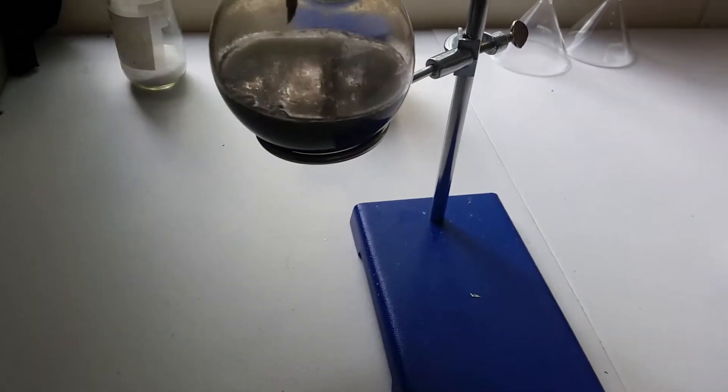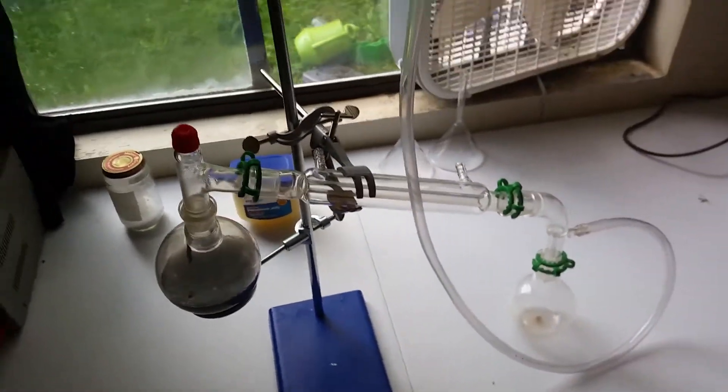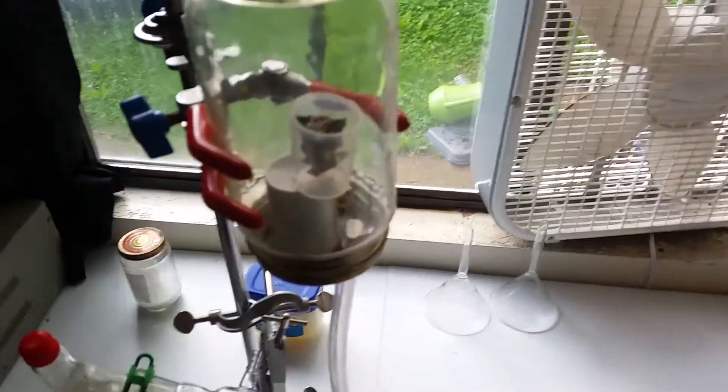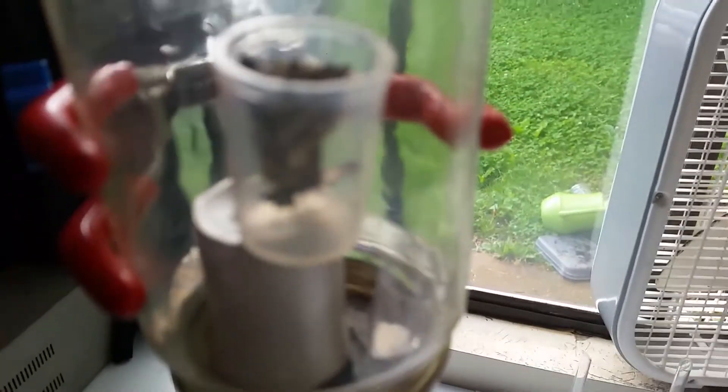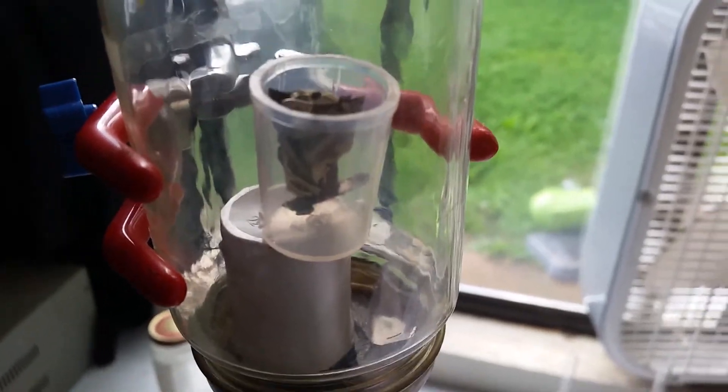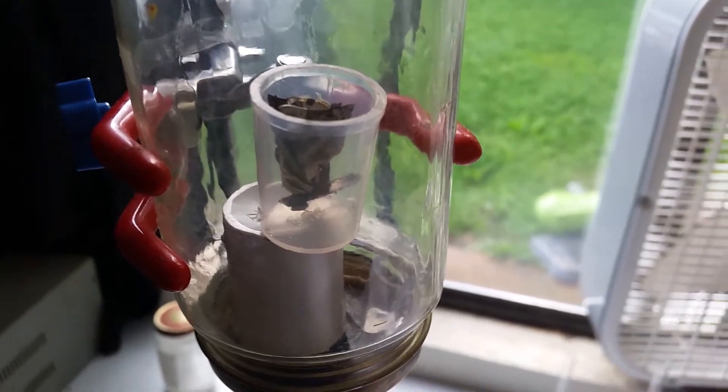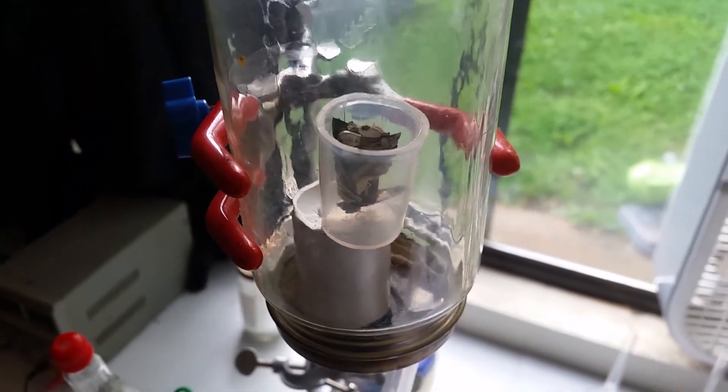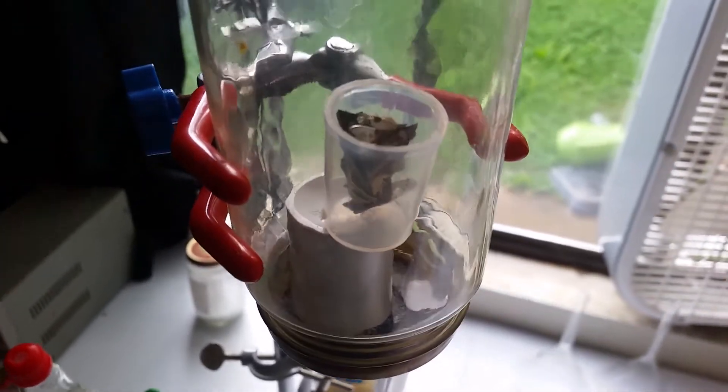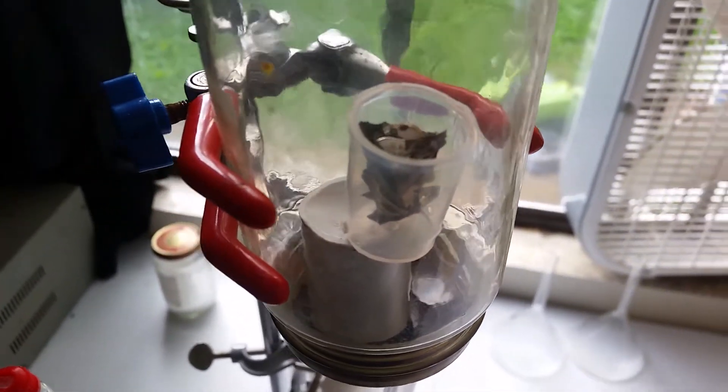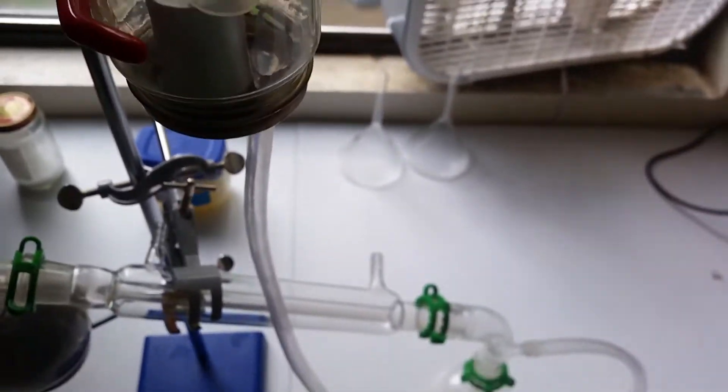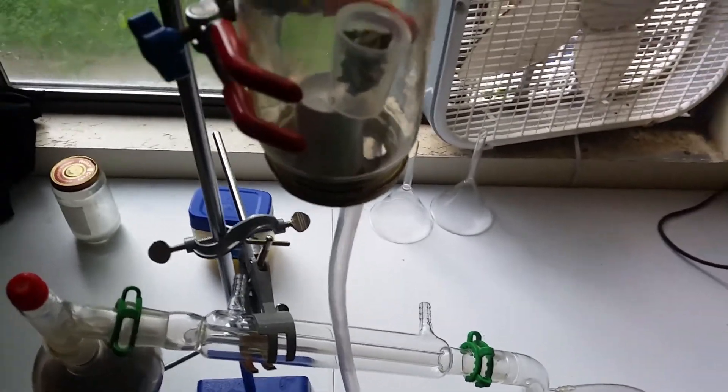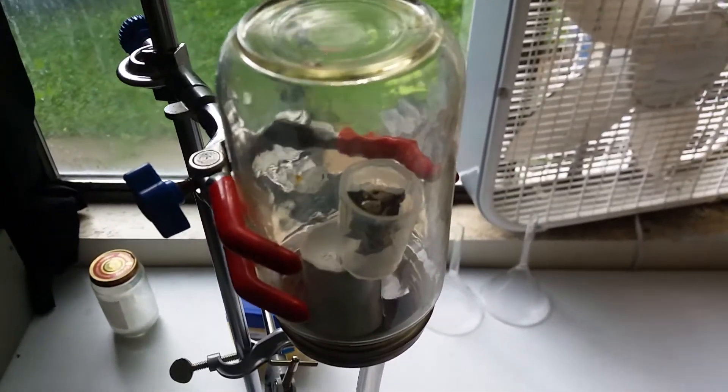So I let this run all night while slowly adding aluminum and allowing hydrogen to pass through. I accidentally bumped the jar a little bit and that's why it's sitting off to the side. But it does not appear to have done much. One of the biggest characteristics of the reaction would be that it's going to turn to powder as well as lose its magnetism. And it doesn't appear that neither has happened. So what we're going to have to do is, I'm guessing, put it under pressure.